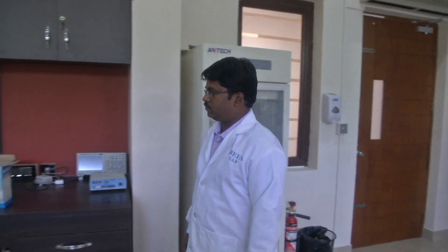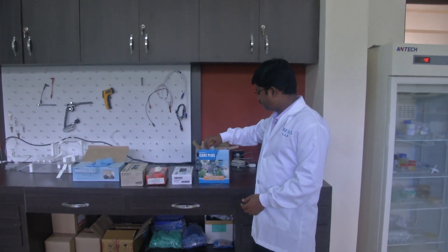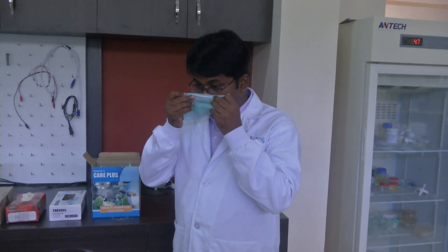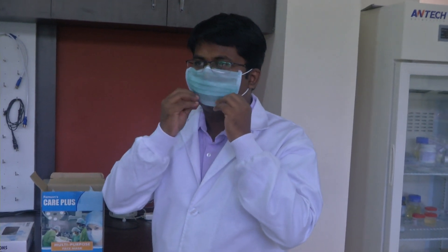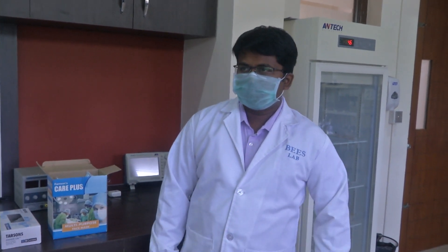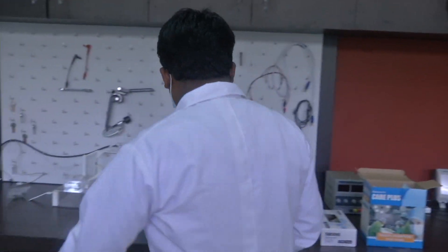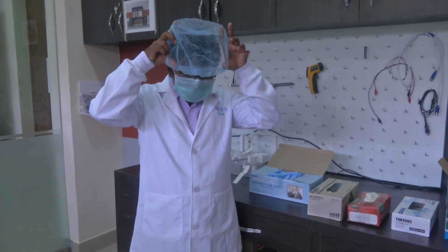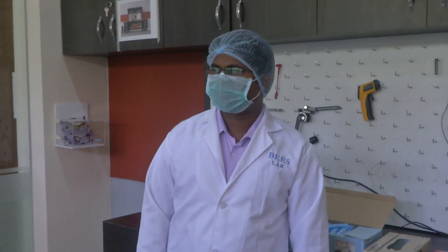He then proceeds to the bench where we have the hairnet, face mask, and gloves. He picks up the face mask, ensuring that the white color thin strip comes on top so that it fixes right on top of your nose properly — so that you don't have to keep adjusting it while you work. He then uses the hairnet and covers his complete head so that there is no contamination due to hair fall.